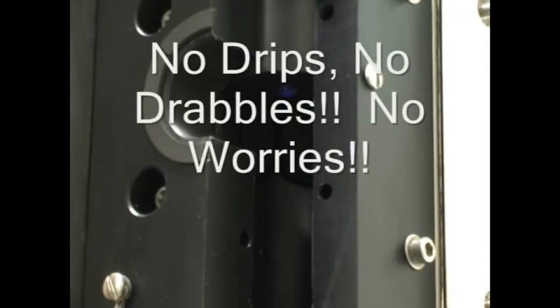Now one more time, let's watch clean starts and clean stops using the auto valve. No dribbles, no drabbles, and no worries.